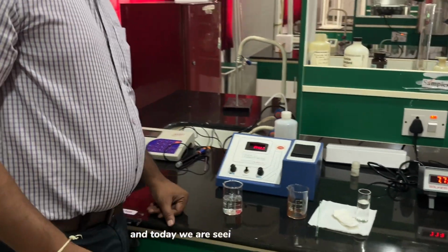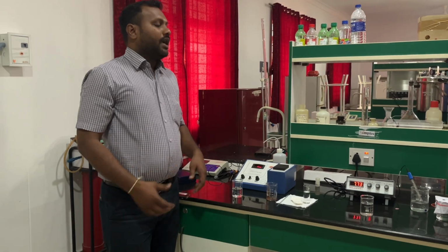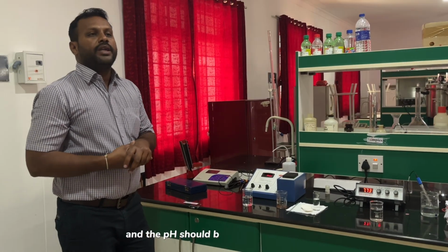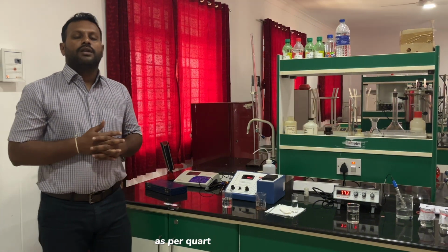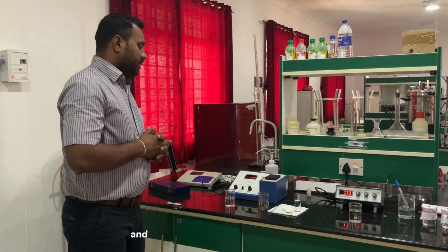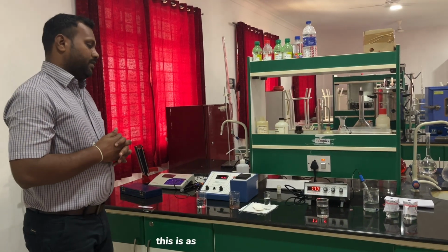Thank you, friends. Today we have seen two experiments, pH and turbidity. The pH should be limited to 6.5 to 8.5 as per the drinking water standard code 10,500, and the turbidity should be less than 5 NTU. This is as per the standard code.